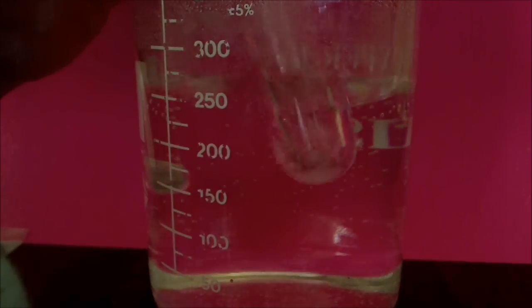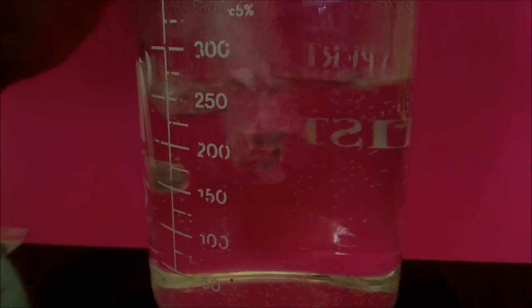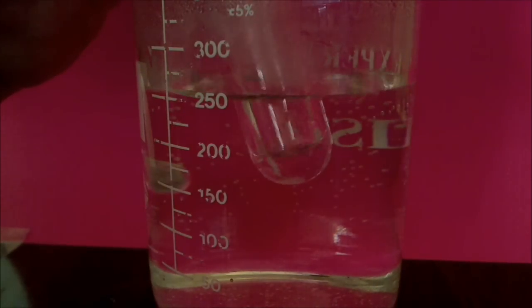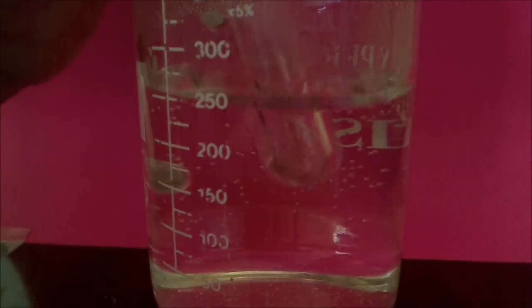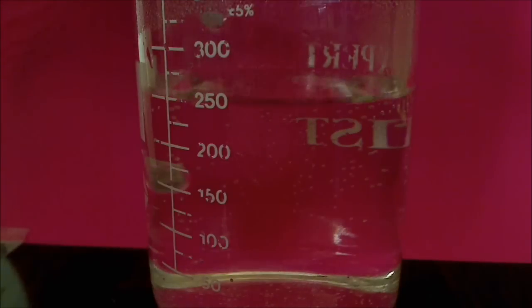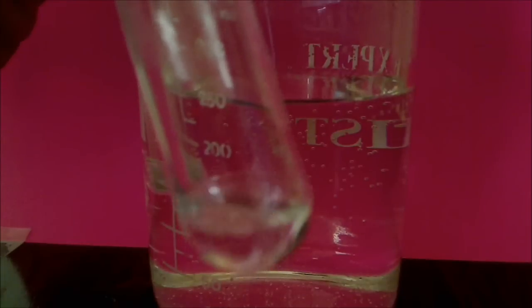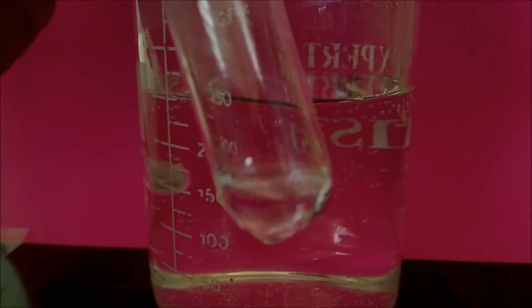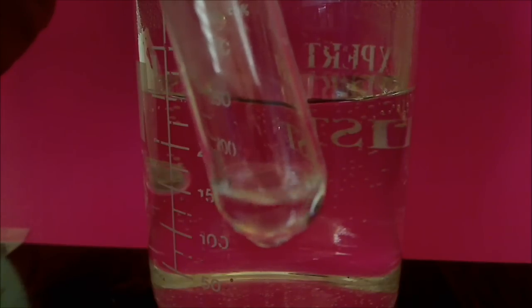If I get a chance, I will demonstrate that with a cooling curve. And not until all the solid melts does the temperature rise above 53.5 degrees. Okay, you can see now it's above that temperature. And then if I take it out and let it cool, it will recrystallize. I'm not going to do that right now, but you can do that on your own and see that that happens.